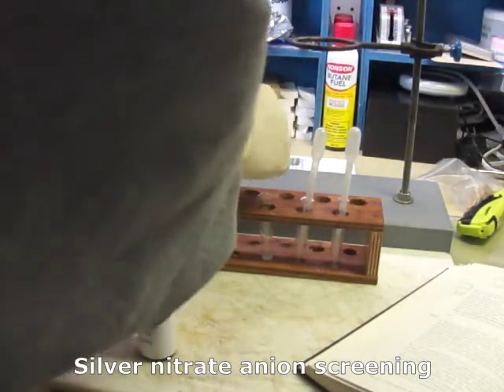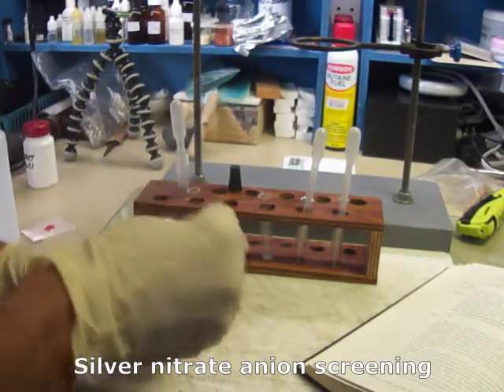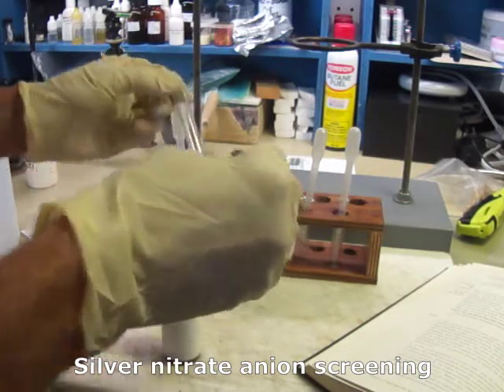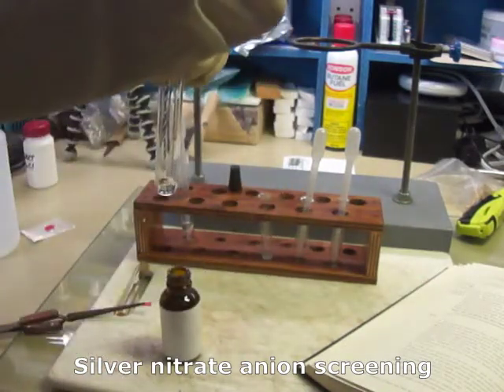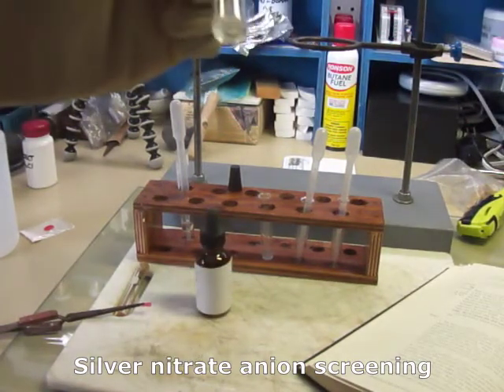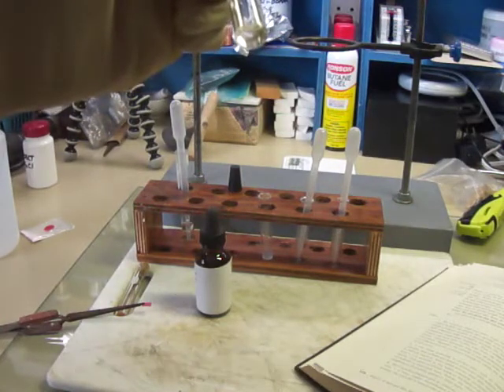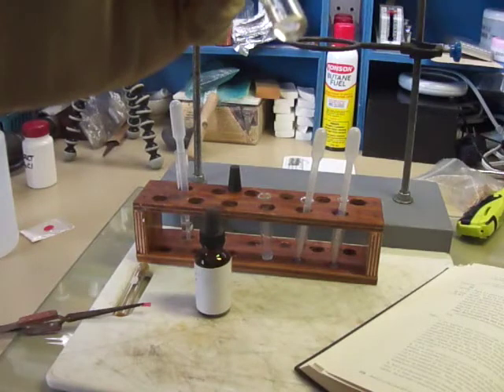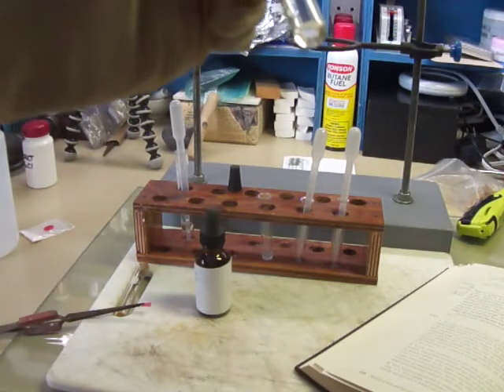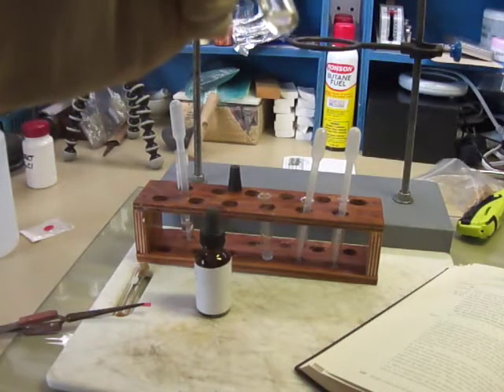I know silver nitrate will precipitate out the chlorides, but I guess it will precipitate some other stuff out too. We'll add a drop of silver nitrate to that and see what happens. And it looks like nothing happens. So what that tells us is that there is no chloride, bromide, iodide, sulfide, arsenate, phosphate, chromate, carbonate, sulfite, or borate. So those are definitely absent.